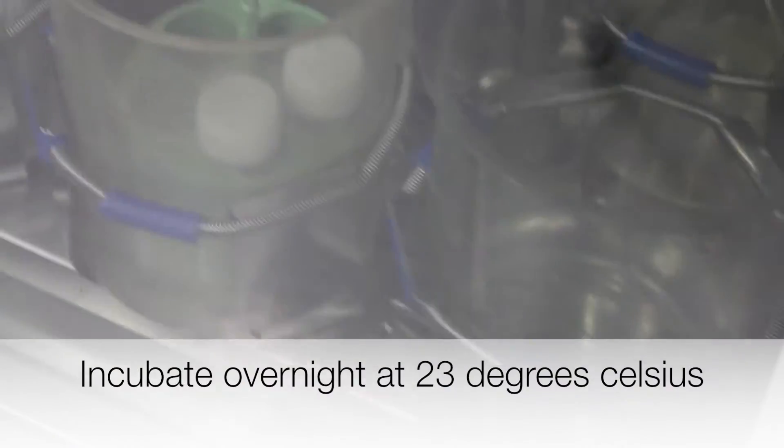The culture is allowed to grow overnight in an incubator at 23 degrees Celsius with shaking.